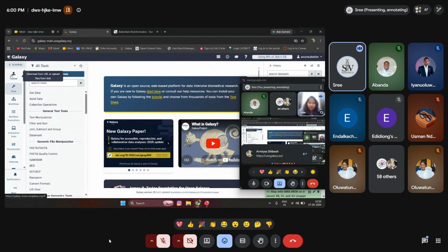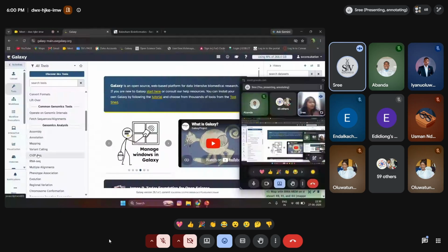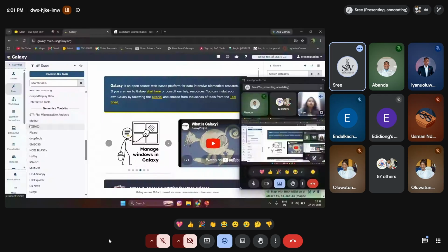The tools are associated into a tab, with different sets of tools, from getting the data to the different genomic tools and datasets you have. You can do FastQ quality control, and different types of file formats and versions will all be highlighted here. What type of analysis you can perform, RNA-seq, alignment, evolution, protein folding, statistical analysis, all will be there.